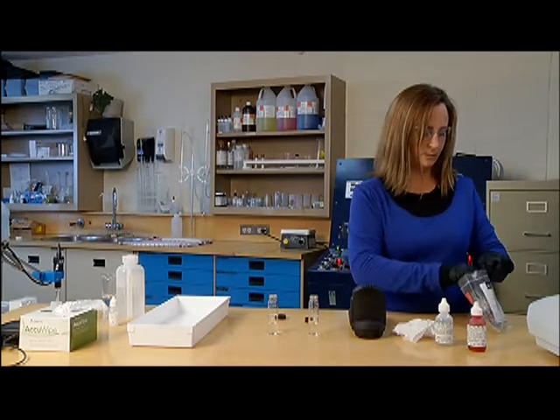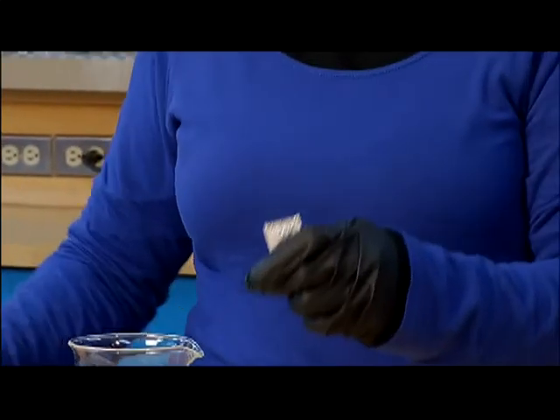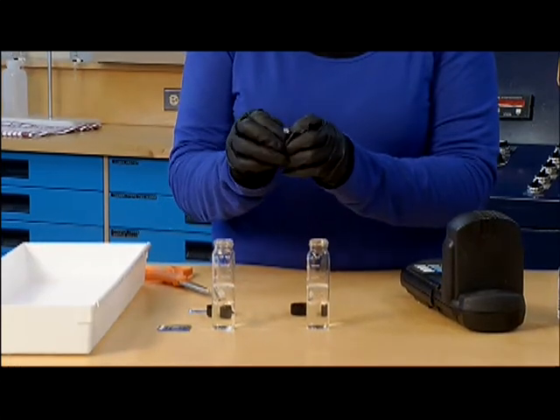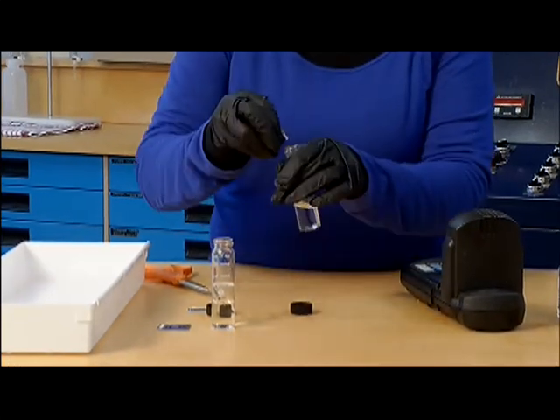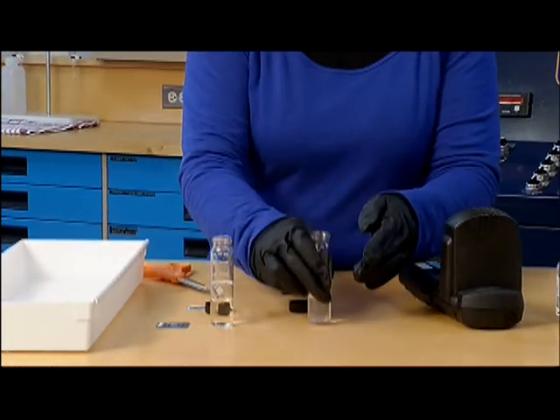The operator then takes and places one powder pillow of the prescribed acid into the first vial and gently stirs to combine the powder and liquid.